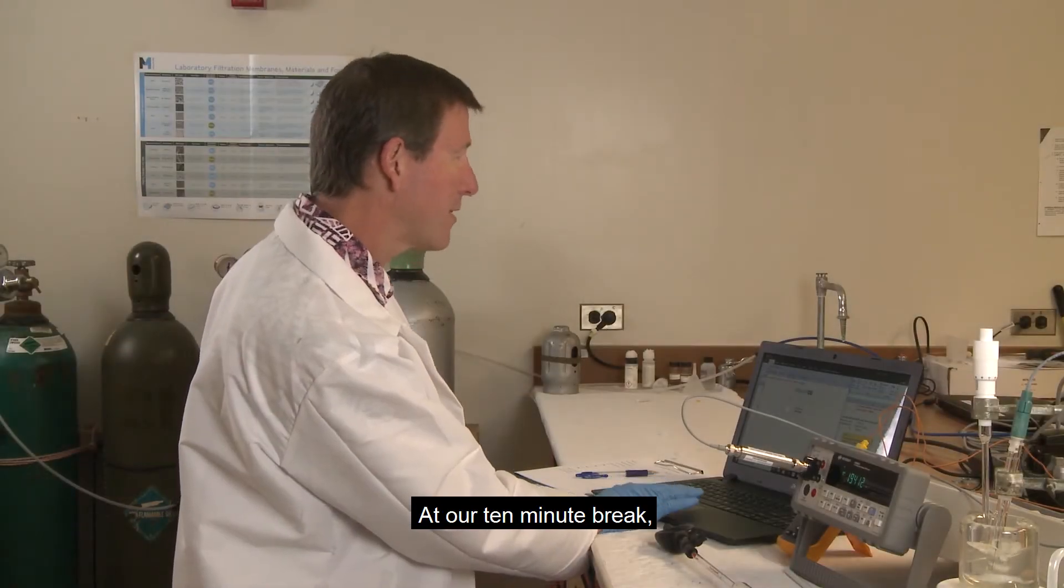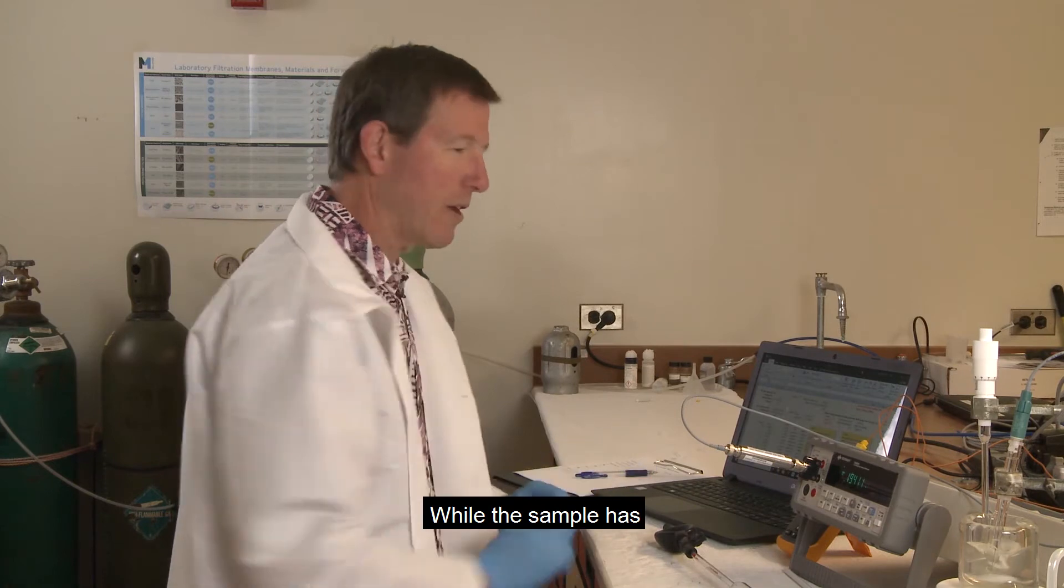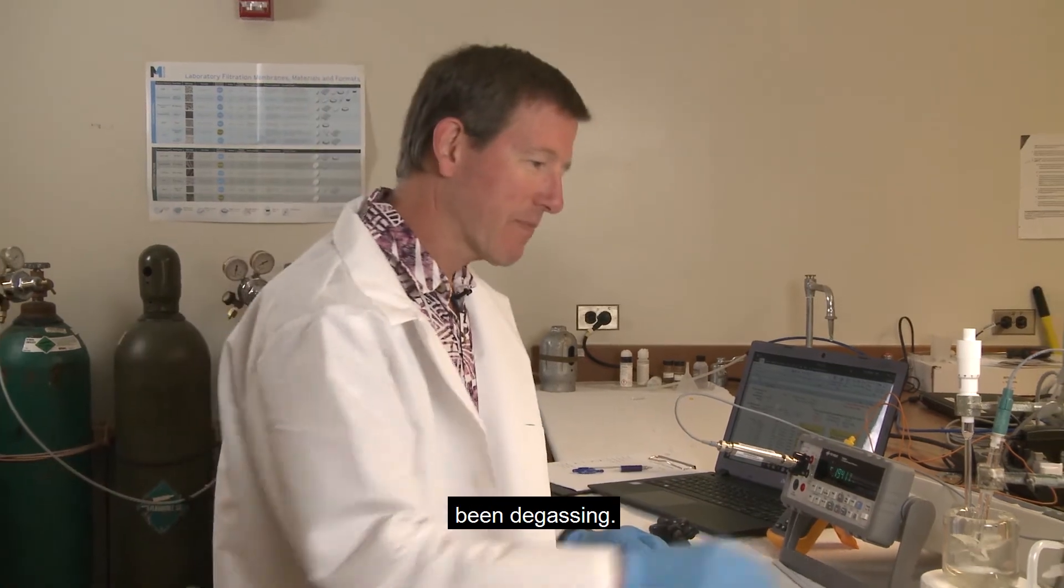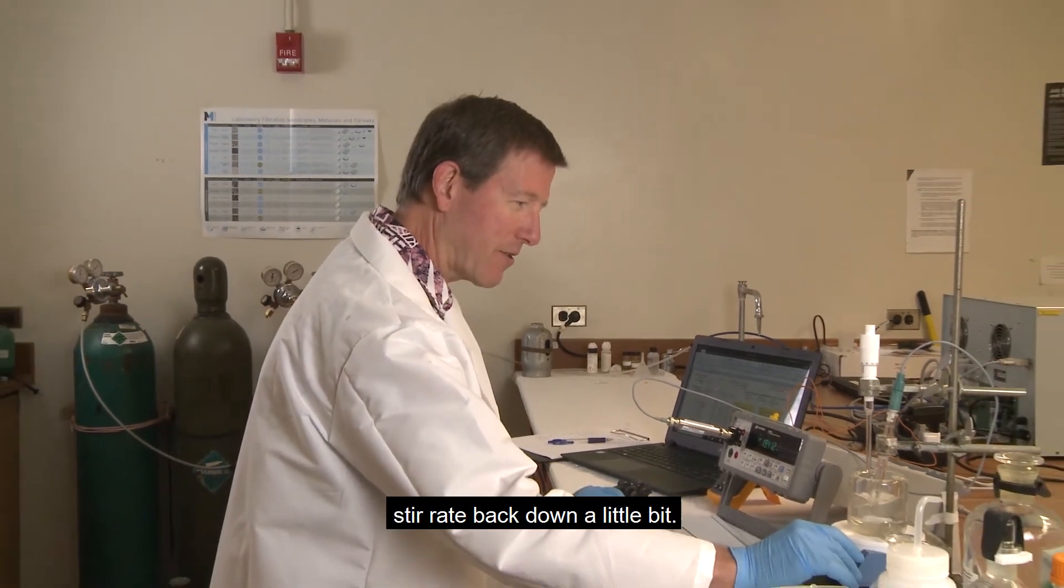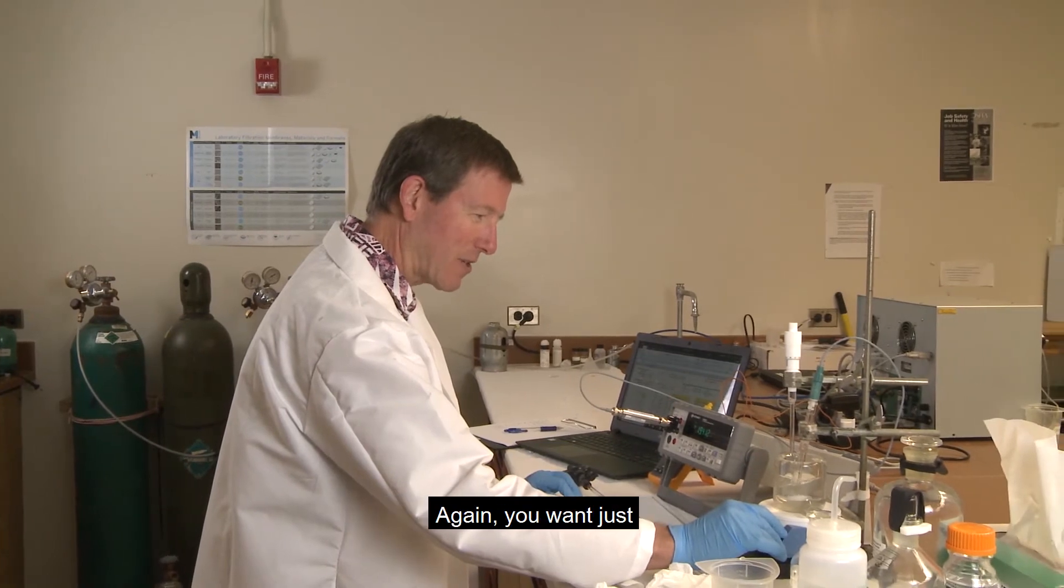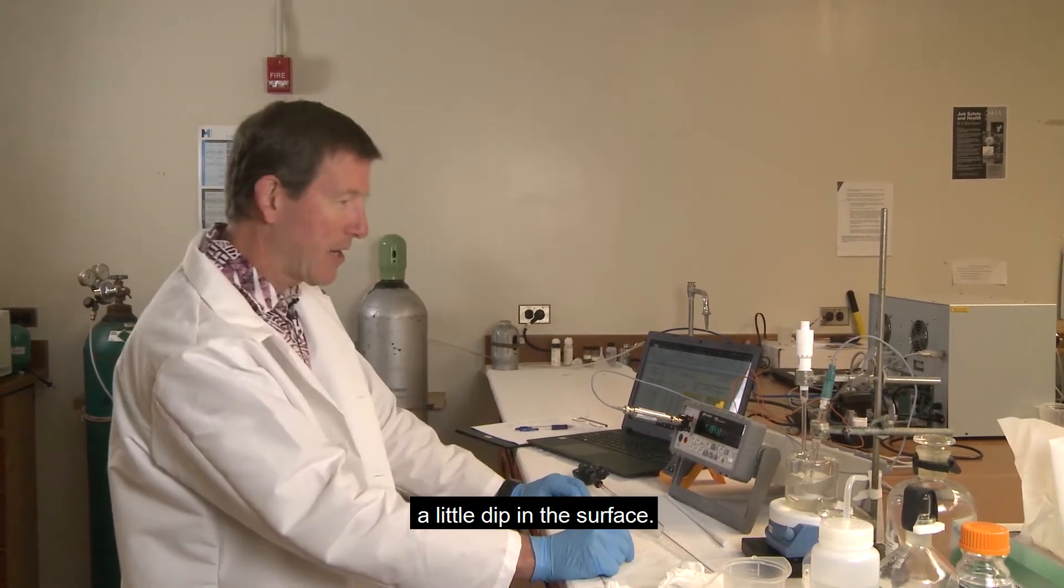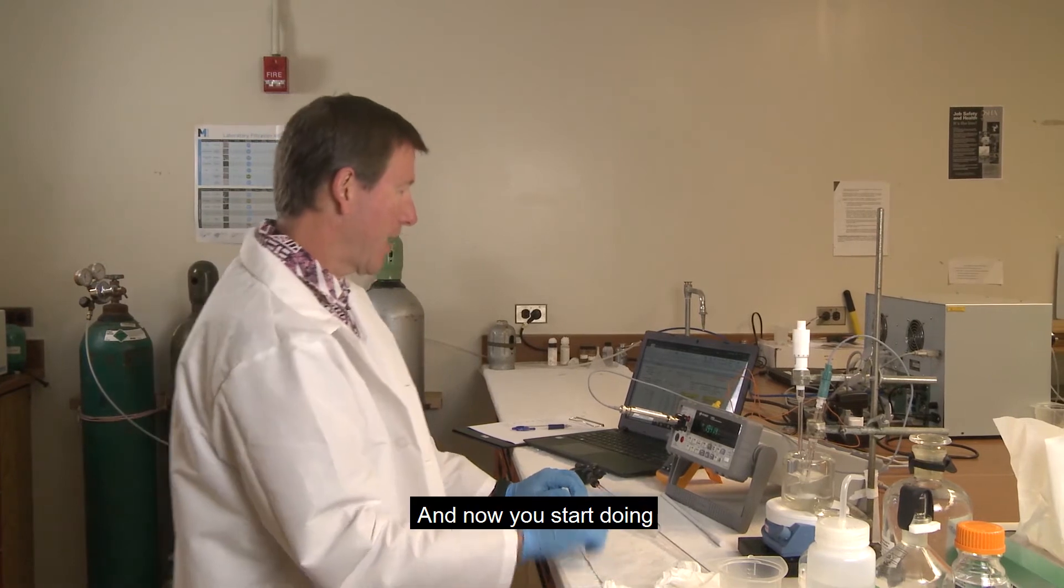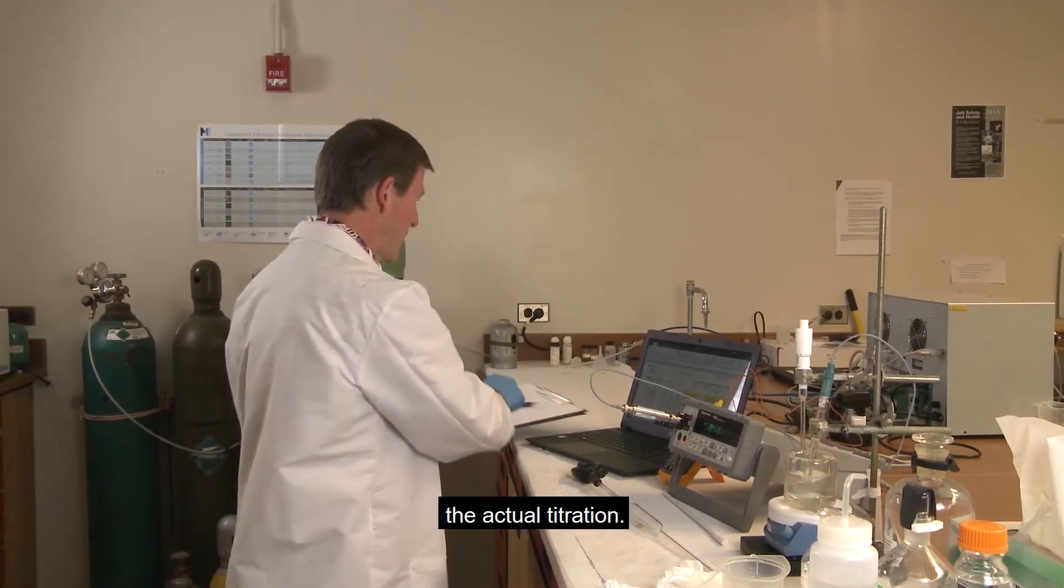We've had our 10-minute break. While the sample has been degassing, we can turn the stir rate back down a little bit. Again you want just a little dip in the surface. And now we start doing the actual titration.